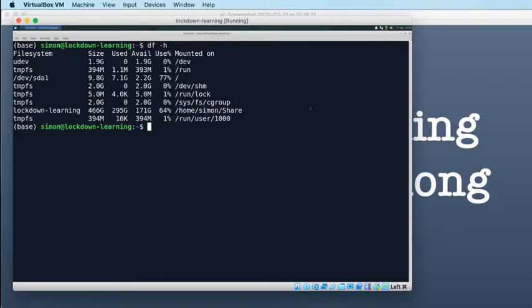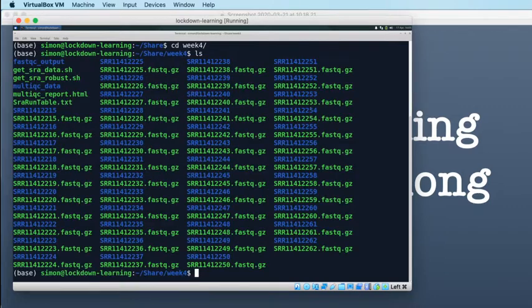The other thing was, I had talked yesterday about a more robust way of making sure that we've downloaded the data that we wanted to download. And so I set off doing that yesterday evening. So I just want to show you what I was doing, week 4. So I made, sorry about the mess of my files, this is part of the results from me doing this kind of experimentation.